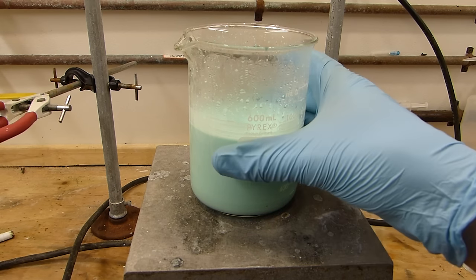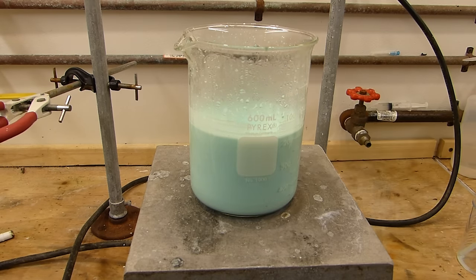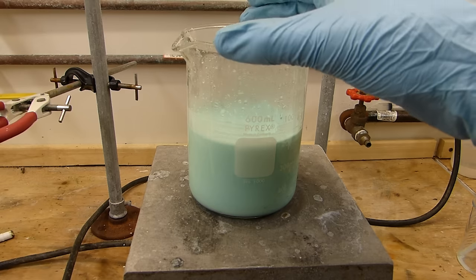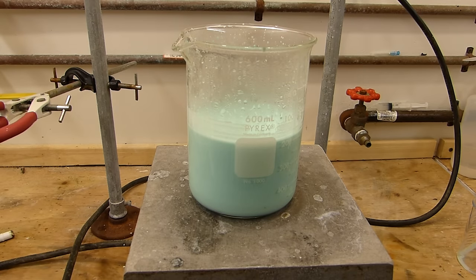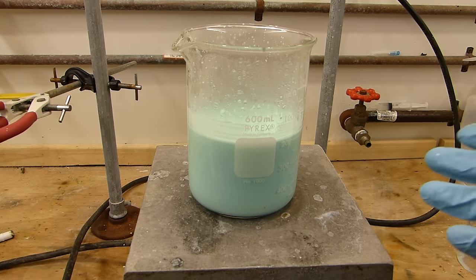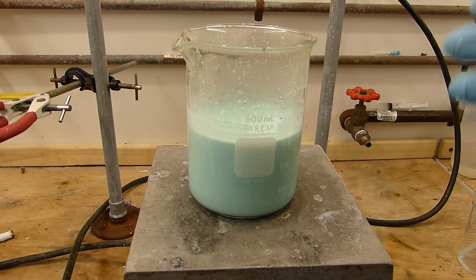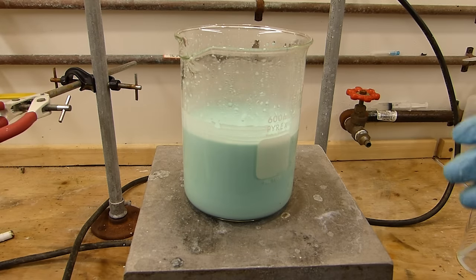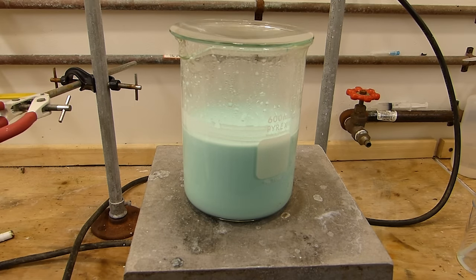Well I've been heating and stirring for approximately an hour and a half. It's quite warm. Not boiling hot but pretty warm. Remember the rate of reaction is increased by about double for every 10°C that you raise a reaction mixture. That's just a general rule of thumb. Doesn't apply to everything but in general. And you saw how slow the reaction initially started to happen. And this is true with the formation of a lot of oxalates. So I just stirred this and heated it to make sure that we got the most we could out of this reaction. Of course we can determine how far the reaction went based on the yield that we measured later. But for now I'm going to call it done. I'll put this watch glass over the top of it and this can go in the refrigerator in preparation for the filtration step.